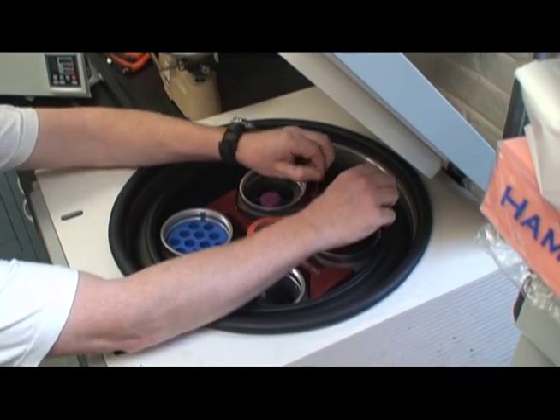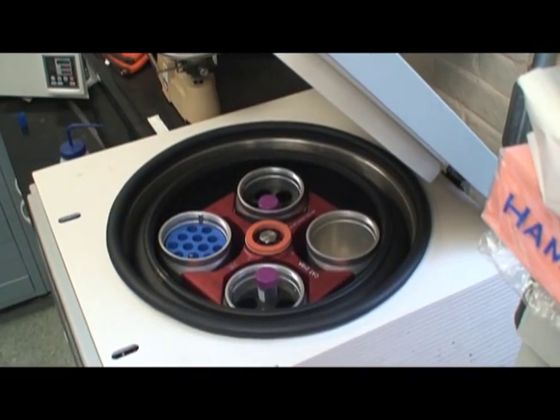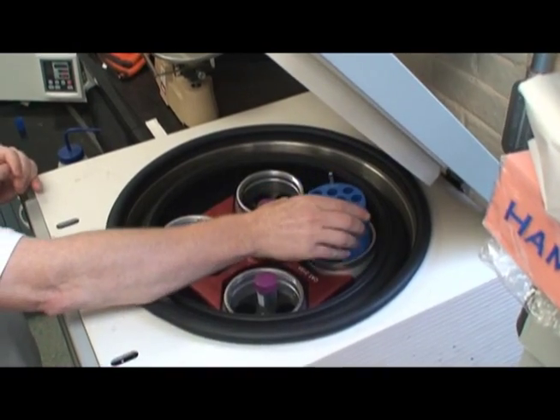Remember, if one holder is changed, the holder directly across must also be changed to keep the weight balanced symmetrically.